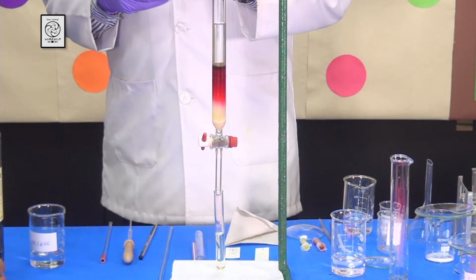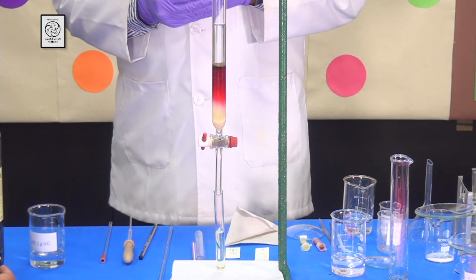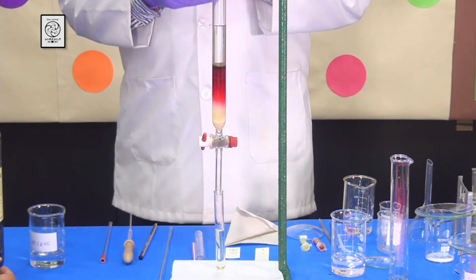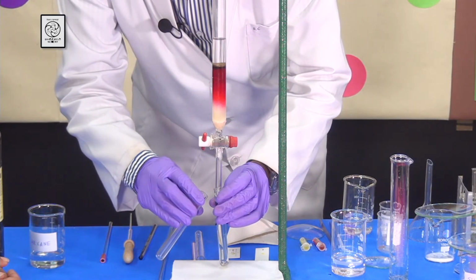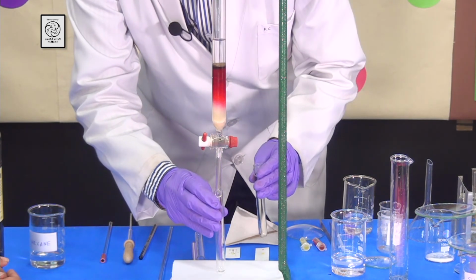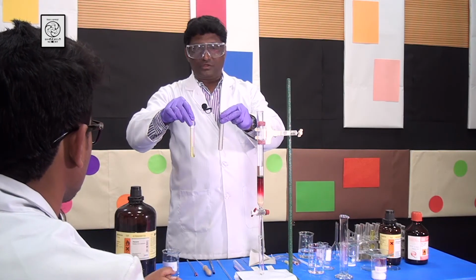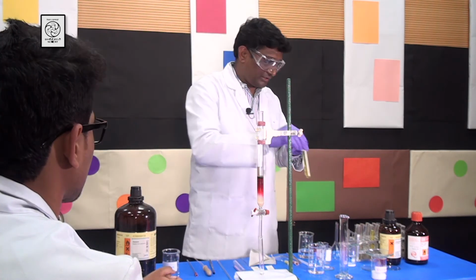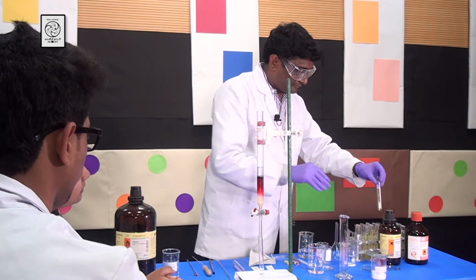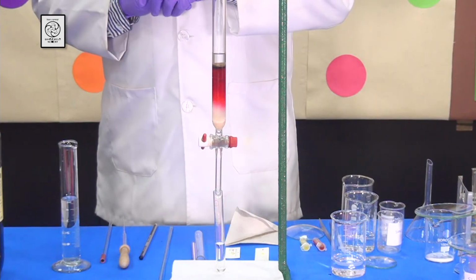So, sir, now I can increase the polarity in order to elute my red compound. I am going to change the test tube again, because you can see the difference between the two test tubes. One is really yellow and the other one is almost white. That is colorless, which says that most of the yellow compound is eluted. Now, students, you can see that the yellow compound is completely eluted.